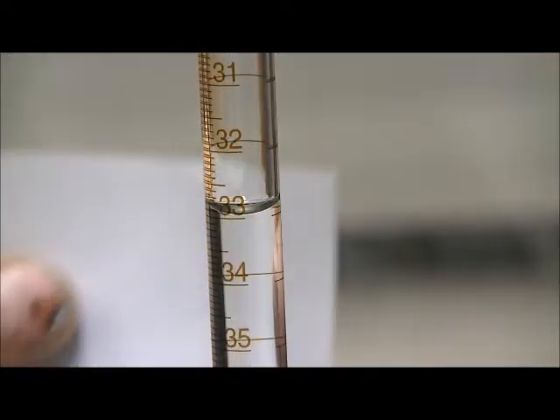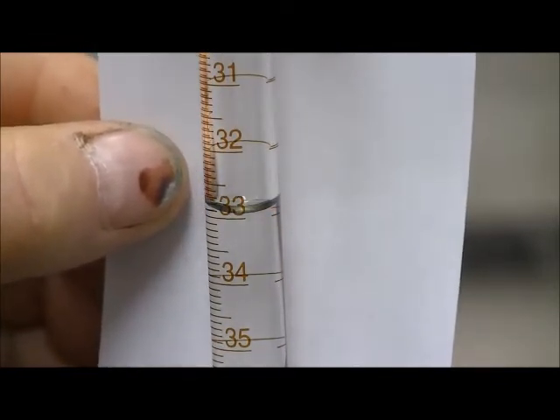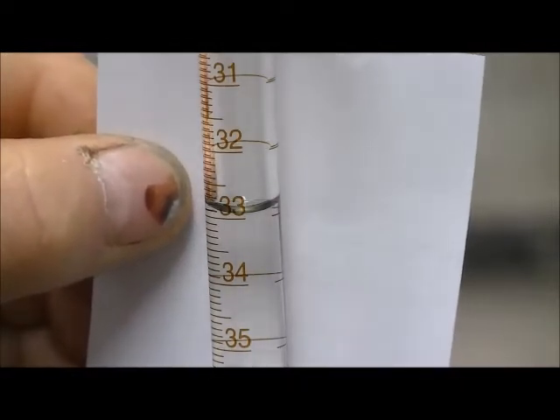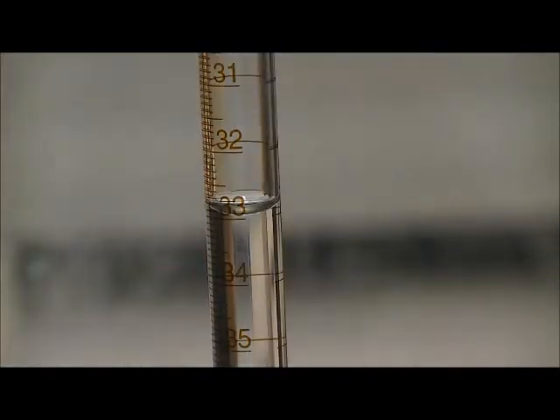And that end point appears to be, oh, just above 32. Just above 33. I'm sorry. I'm going to call it 32.95. 32.95 milliliters.